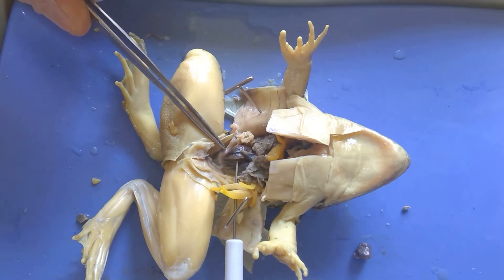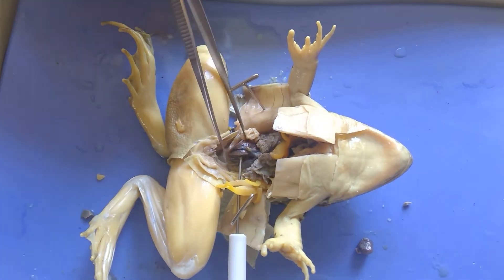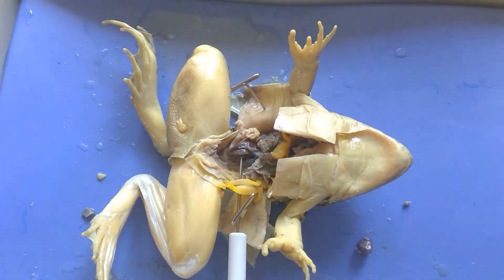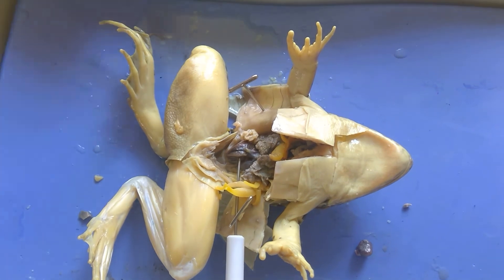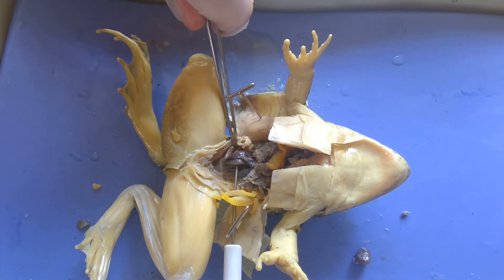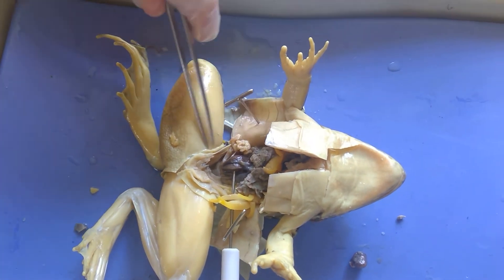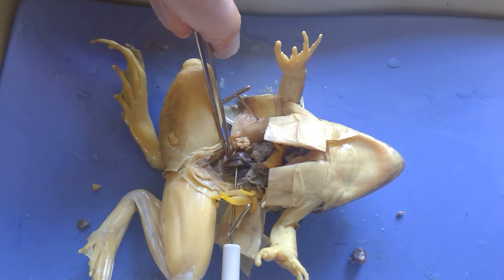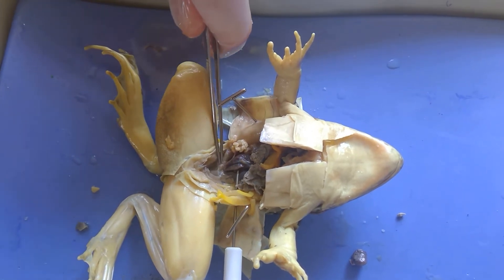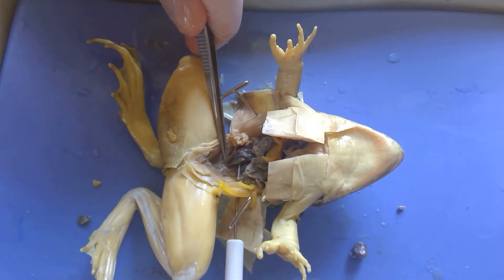On the kidney right here, that's actually the adrenal gland, which produces adrenaline. It has a pretty big adrenal gland relative to the size of the frog — it can do that because it's very strong. Continuing down, there's a tube called the ureter right at the base of the kidney.